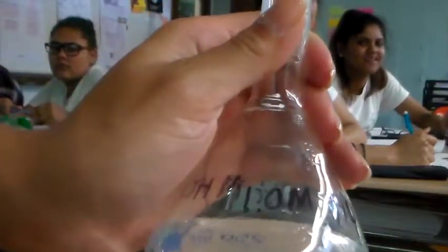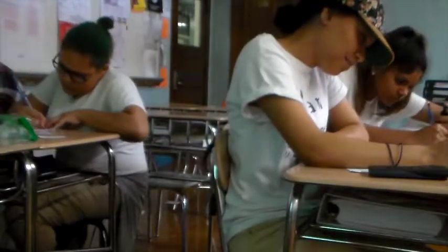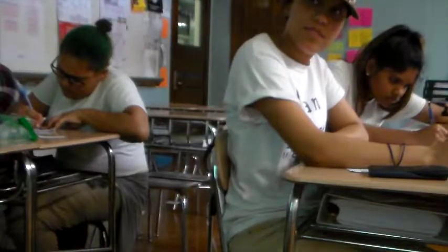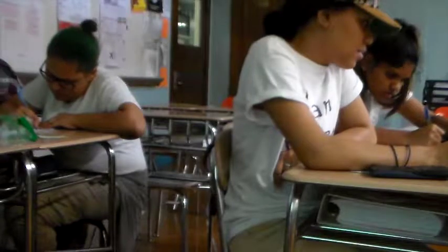The acid, right. Now, I made the acid myself, so I'm going to tell you the molarity of what I made. I made it using this volumetric flask, so it's pretty accurate, and the molarity, for the camera to see, is 1.0 molar. Write that down: the acid is 1.0 molar. That is the concentration that I made.